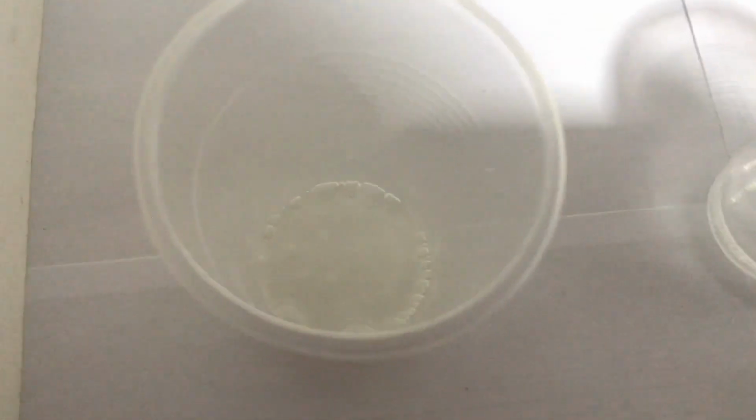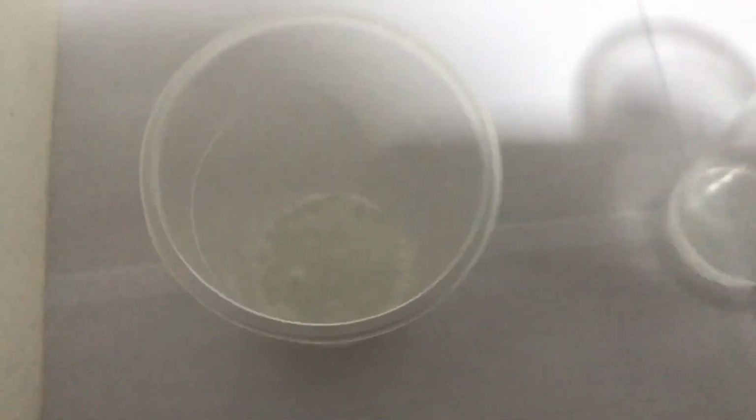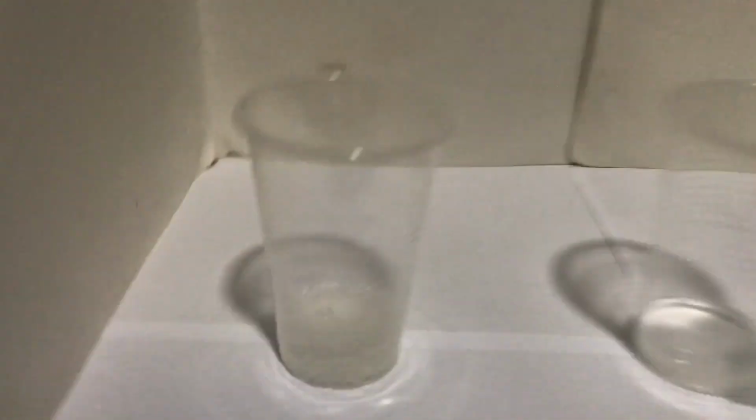As we have seen from the video experiment, less gas evolved as the concentration decreased from cup A to cup C, and the overall volume of gas also became successively lower in each decreased concentration. This is because there were more molecules of hydrogen peroxide in the higher concentrations, meaning more collisions took place, and there was a greater probability of successful collisions. This resulted in more enzyme substrate complexes formed in the higher concentrations, and fewer in each decreased concentration.